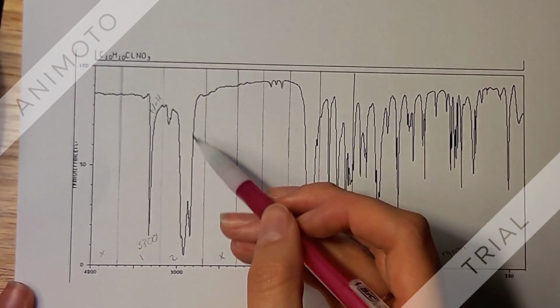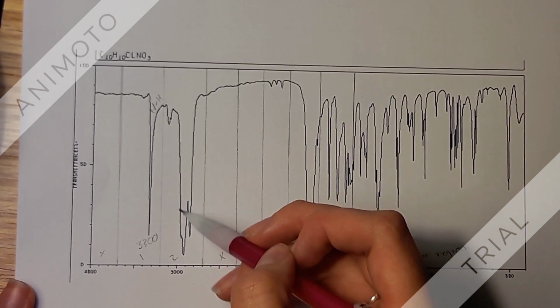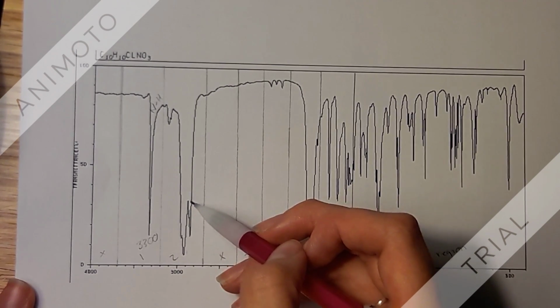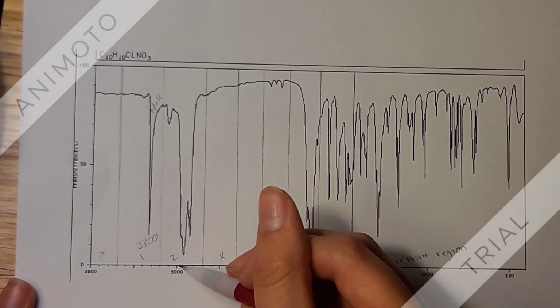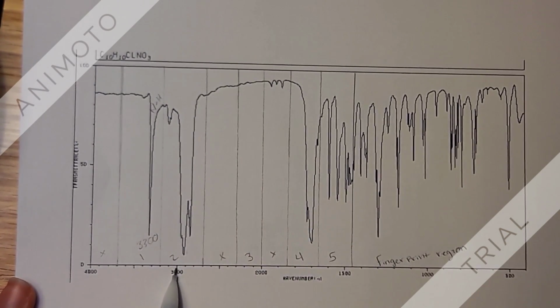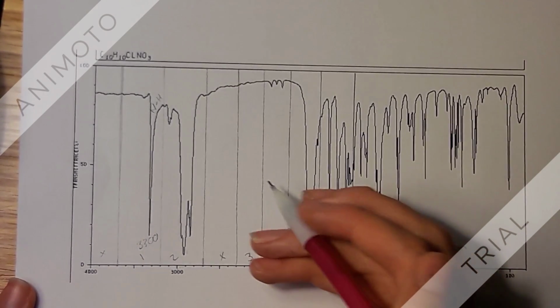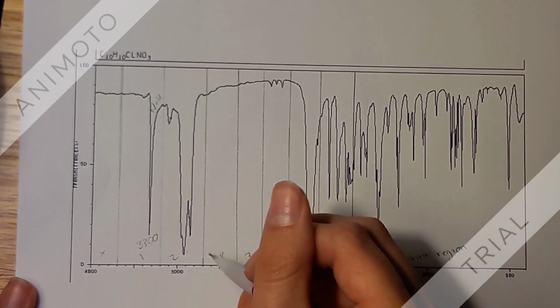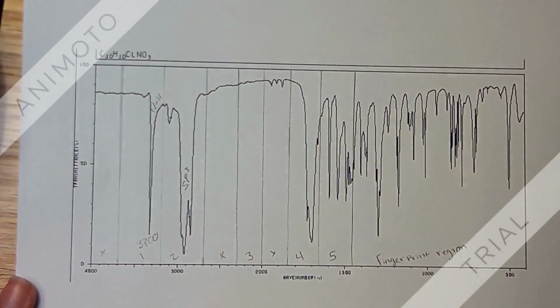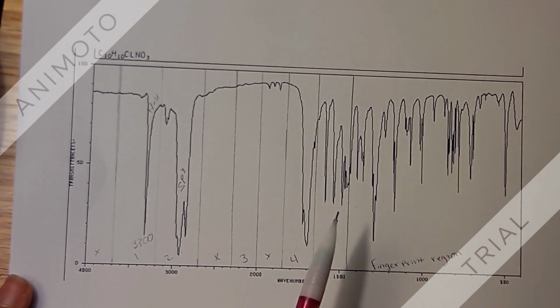And then the second region that we have here in zone 2, we have this relatively large and quite wide and bulky peak, but it's on the lower side of the region, so it's before 3,000, between about 3,000 and 2,800. And so this region is the sp3, and it kind of just tells us that we're going to have sp3 carbons within our molecule structure.